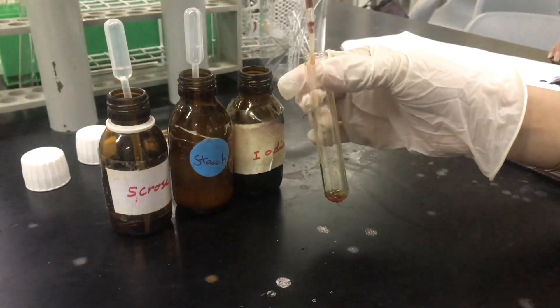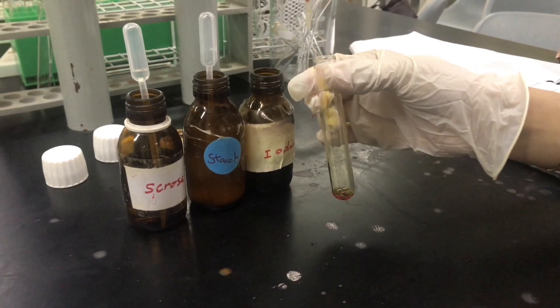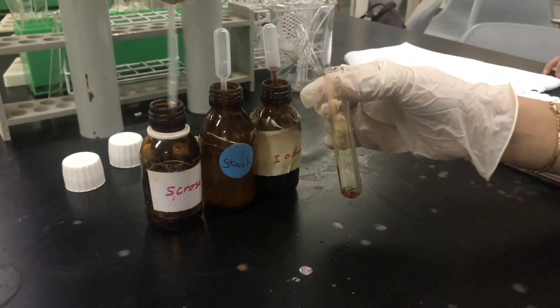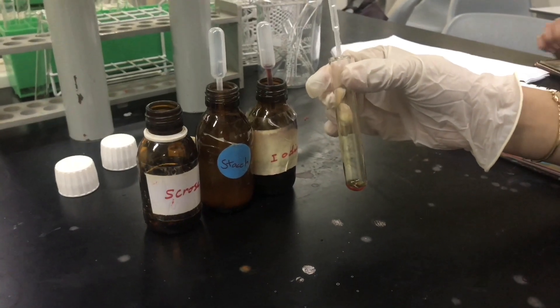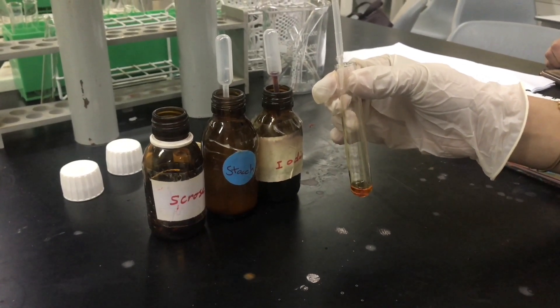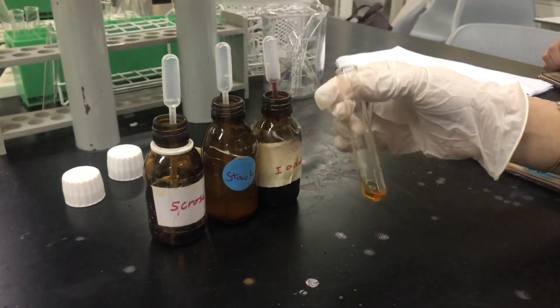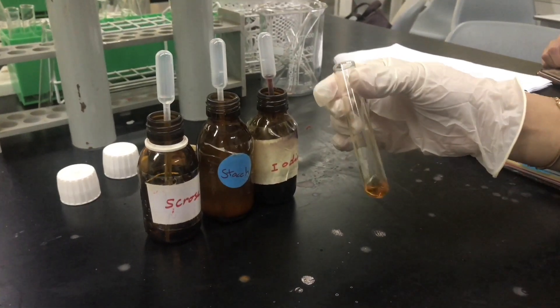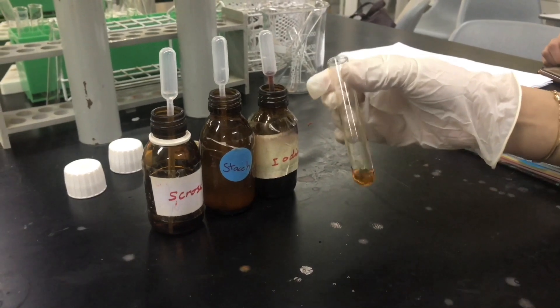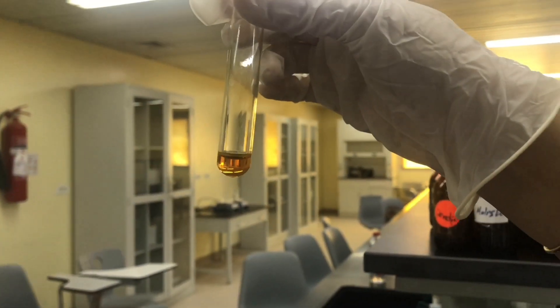Now we're adding a few drops of iodine to the test tube and then adding one mil of sucrose, just so you can see the negative result of this test. With sucrose or any other carbohydrate other than starch, you're not going to observe any change in color. It might be lighter due to the dilution of iodine, but you won't see a change in color.